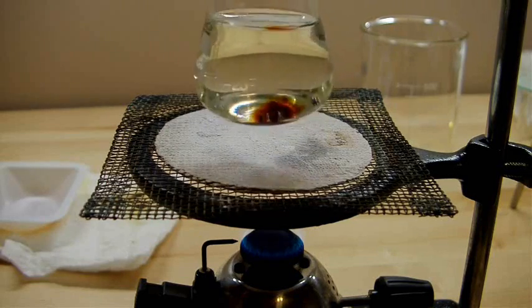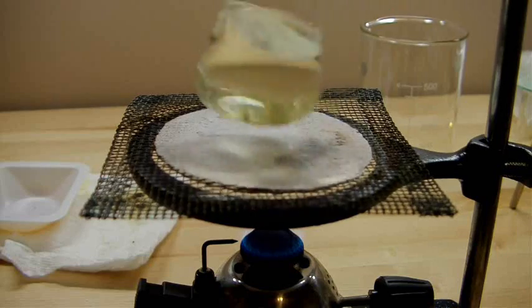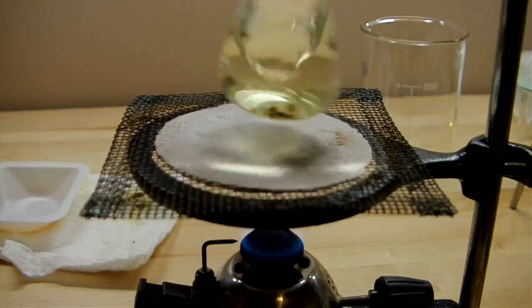Again you can see the iodine sort of spread out on the bottom and as the solution is swirled it disappears more or less.